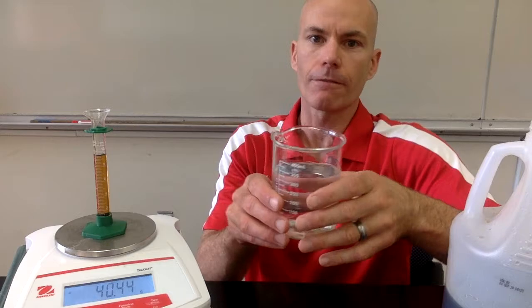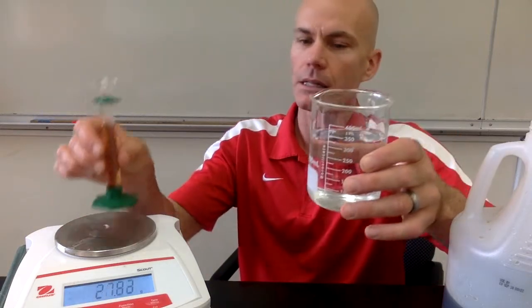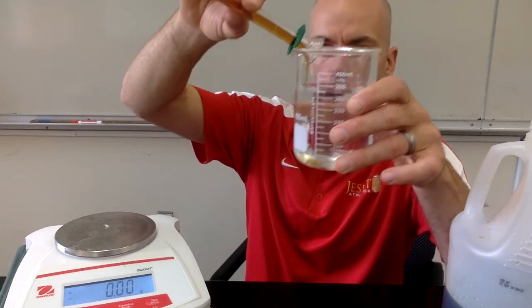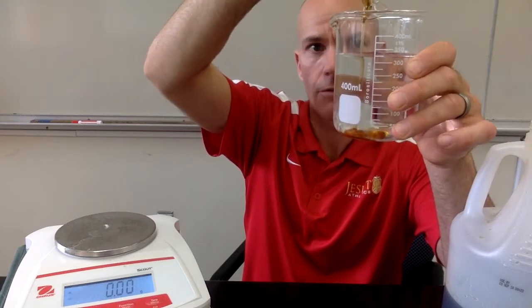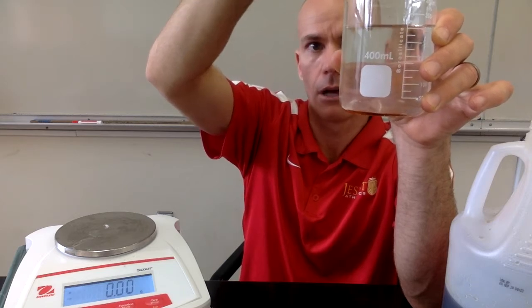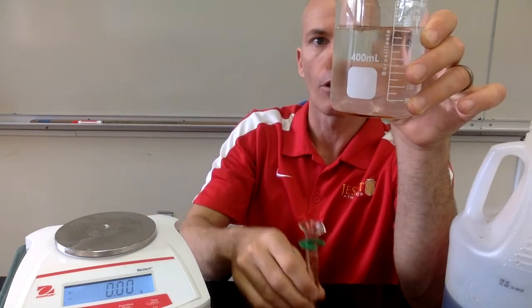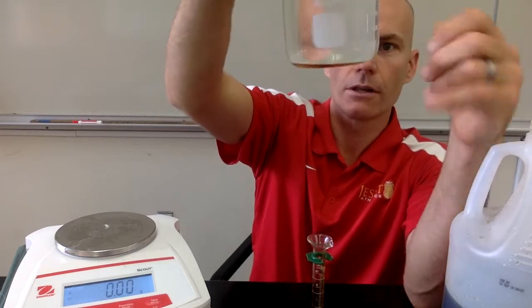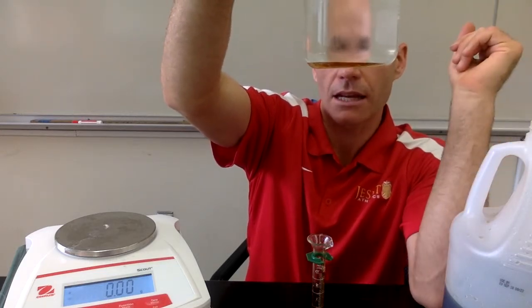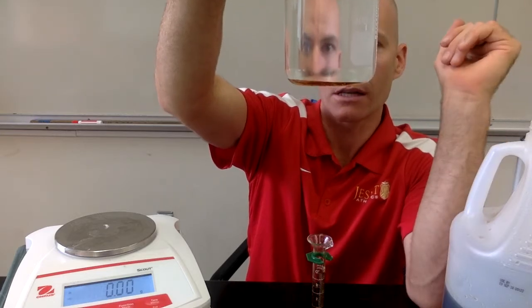We're going to find out if it floats or sinks in water. So I have a beaker of water here. I'm going to pour some of my syrup into it. And hopefully you can see that on the video. But it seems like the syrup is pretty much going down here to the bottom of the water. So the syrup sinks in water, and you can see that right here. We're going to see if the density has anything to do with whether something floats or sinks in water.